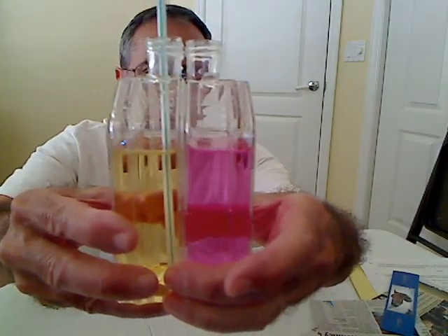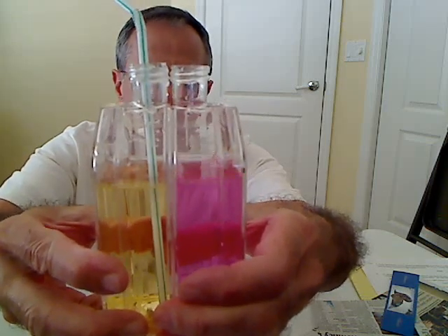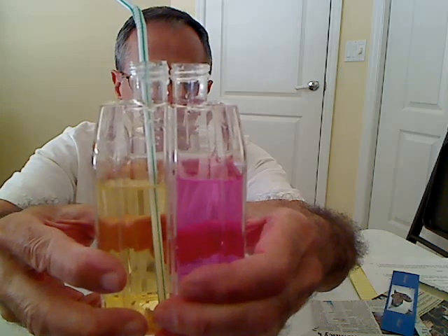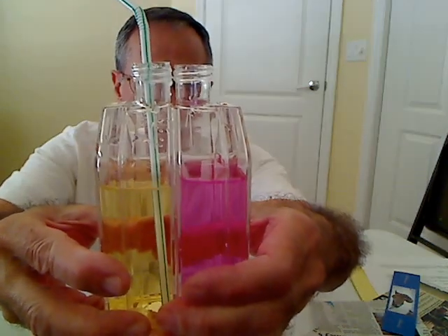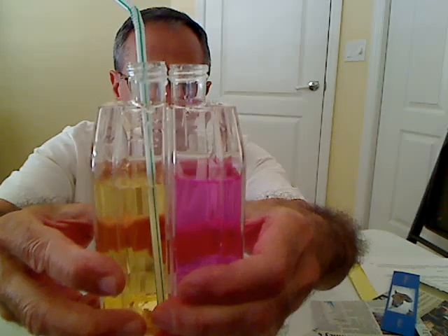You can see very nicely there that the solution with the expelled breath has changed color due to the carbon dioxide in the expelled air, and it demonstrates that carbon dioxide is indeed a weak acid.